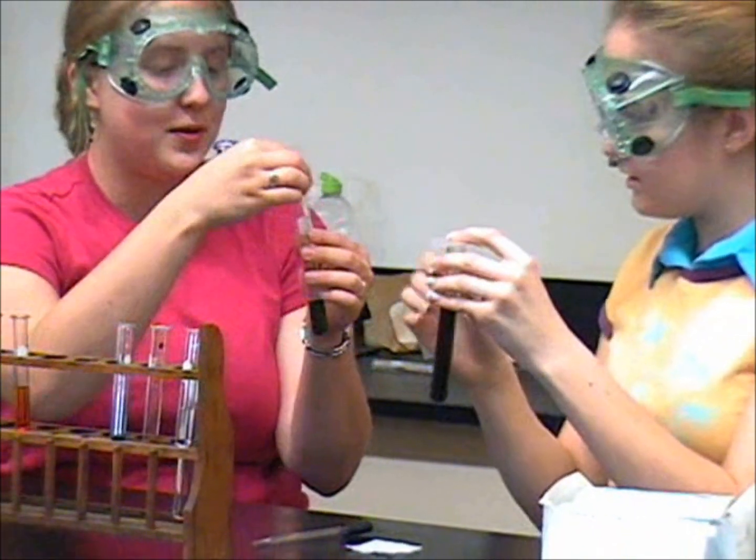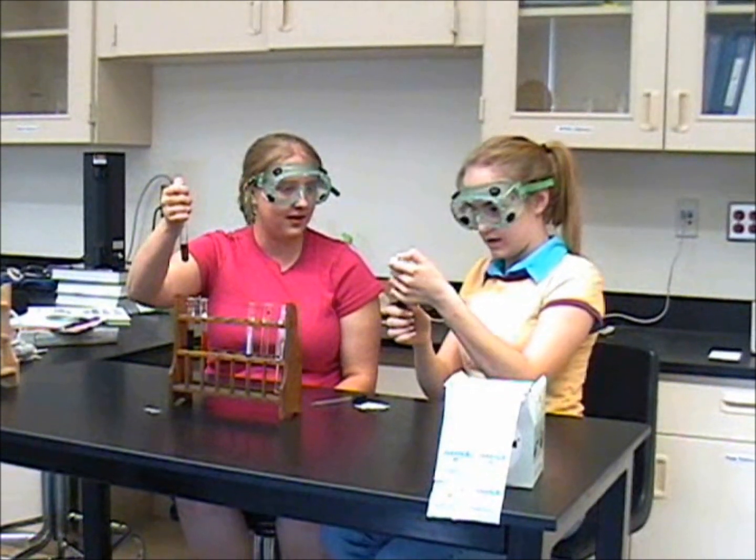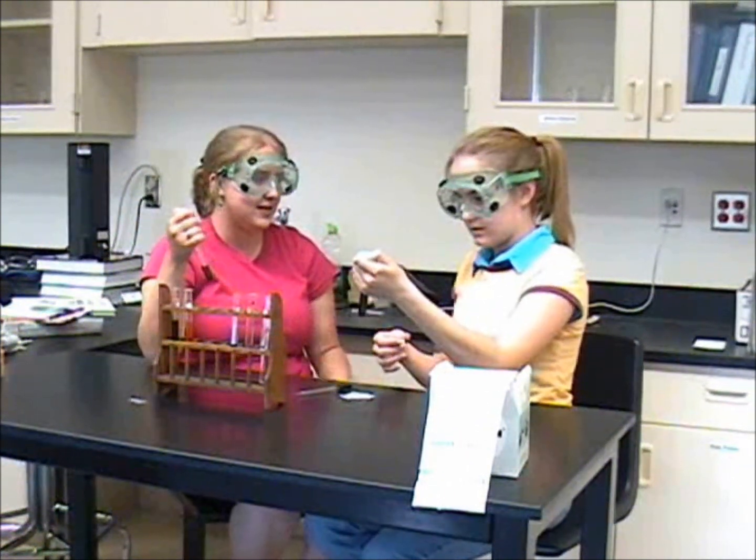So all you do is put it on as securely as possible, place your thumb over top, and gently shake. But I thought you were supposed to shake it really hard. No. See, you'll get stains on your clothes.